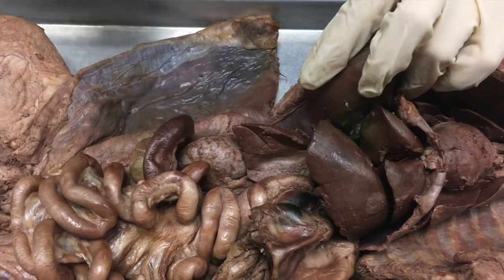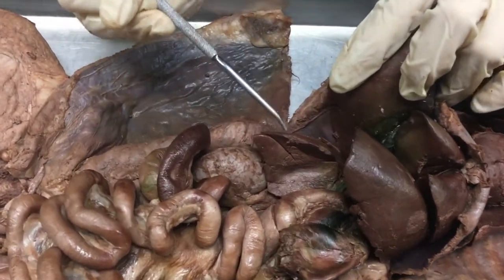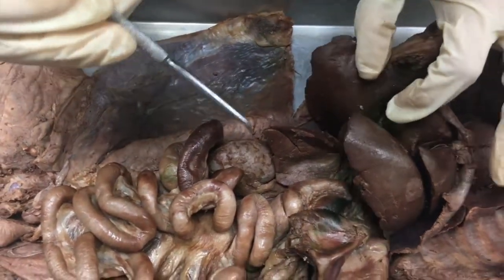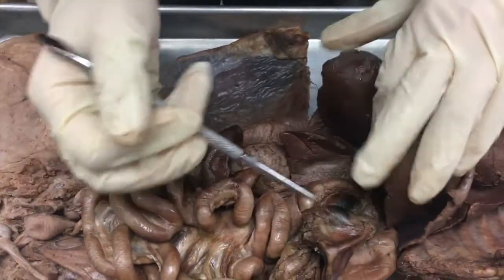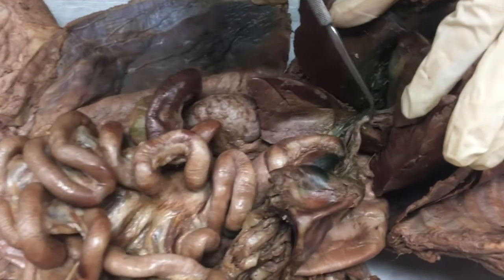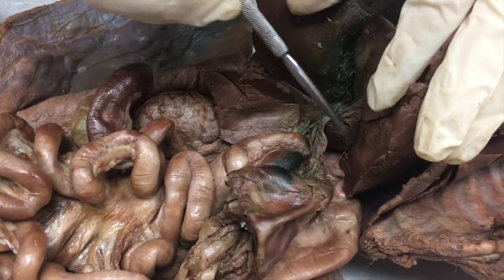The right lateral lobe has an anterior portion and a posterior portion. The last lobe of the liver is the caudate lobe, which is this very tiny little one here.